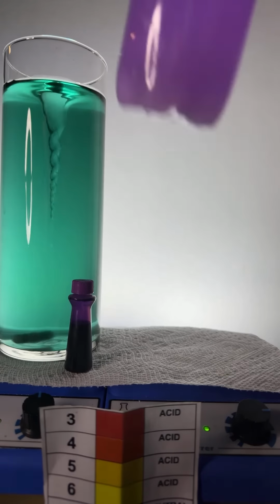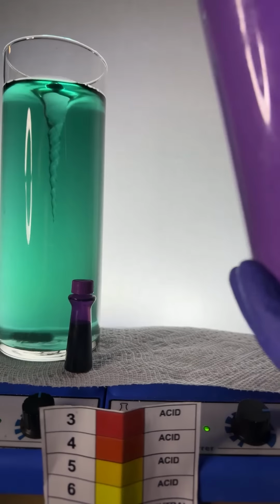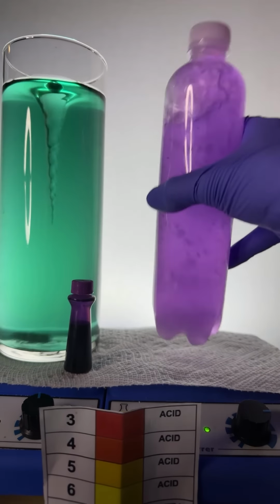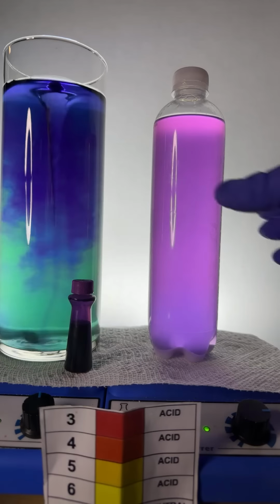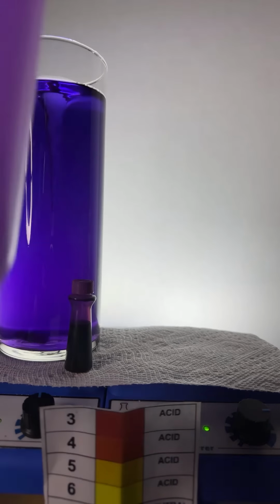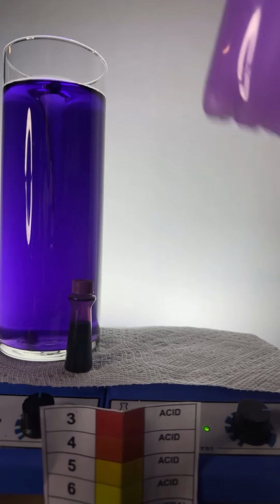Come on, man. Get the salt in there. Get the salt going. I hope it dissolves. Let's see if it's working. It's not quite dissolving enough of the salt yet, I can tell. So we're going to keep going. I got to shake this up. Shake, shake, shake. Come on, man. Because it's cool when it goes.